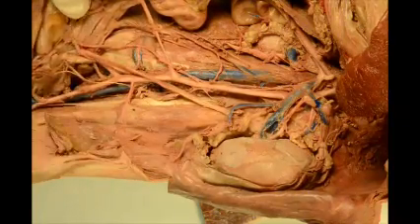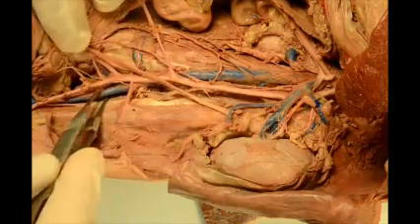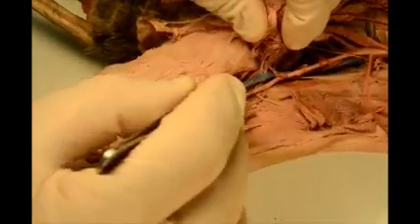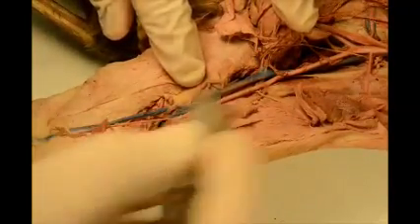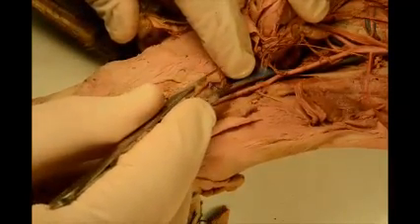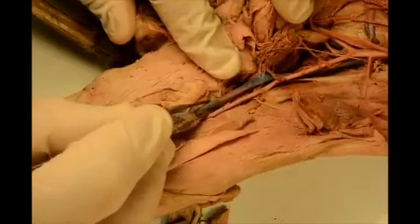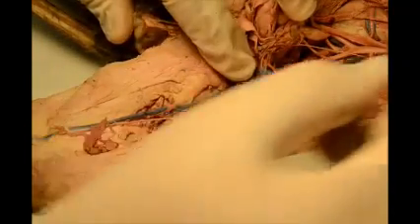And then it will fork into the left and right common iliac, which is here. So this is the left common iliac, and the right common iliac is back there. I'm going to slide the cat up a little bit so you can see the leg. They call it common iliac because you have blood flowing from the foot to the inferior vena cava by two main branches: the external iliac, which is here, and the internal iliac, which is down here. External iliac, internal iliac, turns into common iliac. If you're thinking about blood flow, the name should make sense.